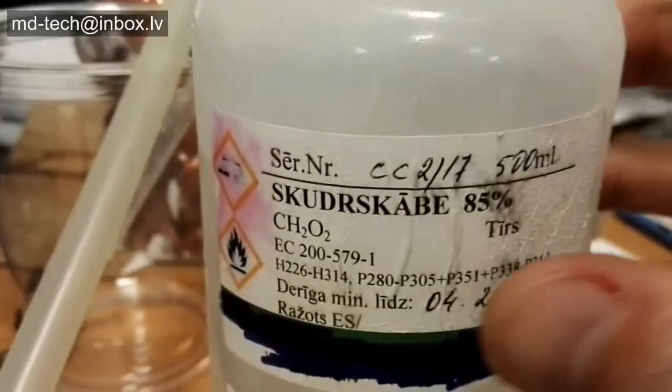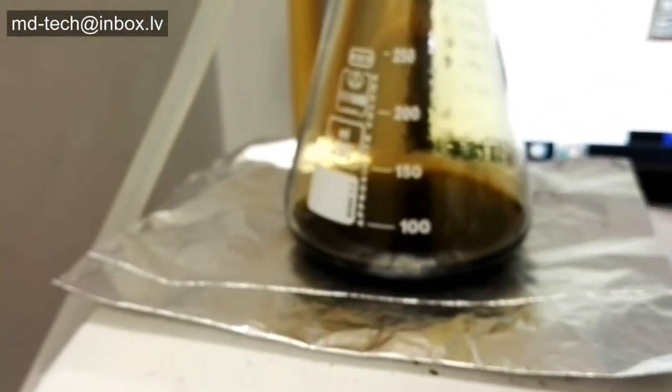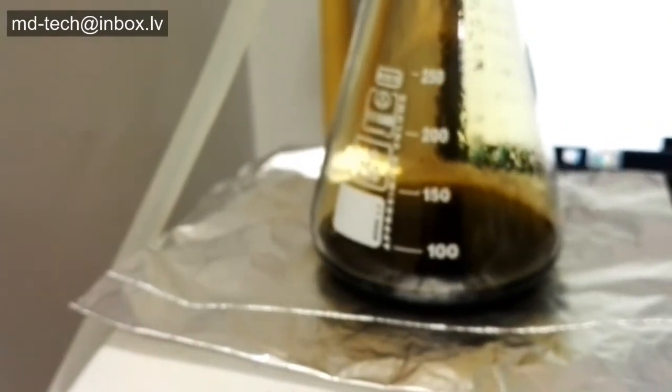Now it is very important to drive out nitric acid. I use formic acid at high temperature, 100 degrees Celsius, to start the reaction. Add a small amount at a time. If there are no brown fumes and a lot of bubbles forming, the process is done.